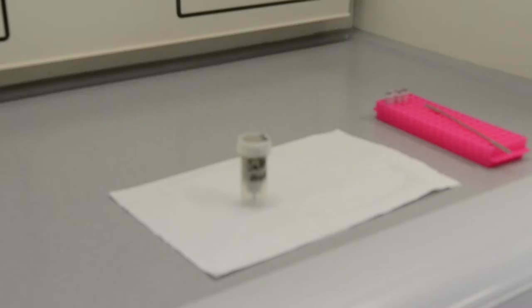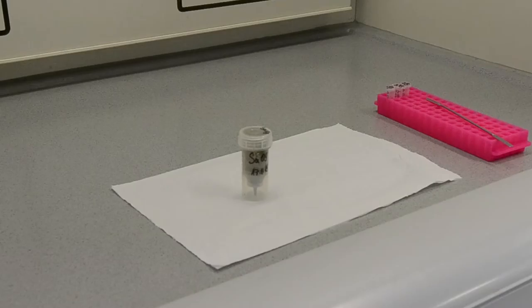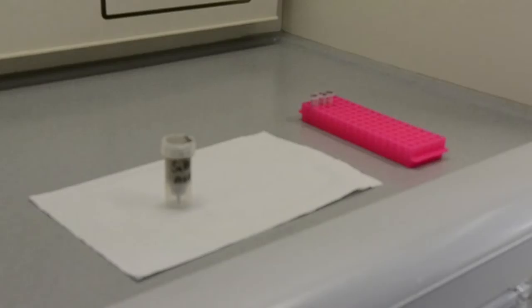Then, the tube, which now contains the finely ground tissue powder, is brought to a cleaned workspace, where a spatula is used to transfer tissue from this one sample into three Eppendorf tubes for DNA salt extraction.